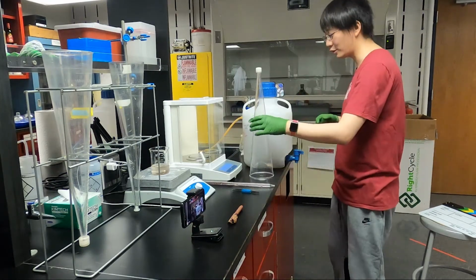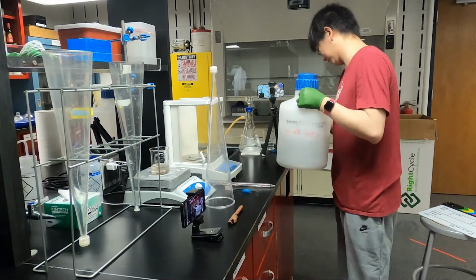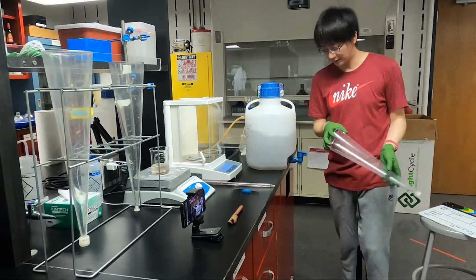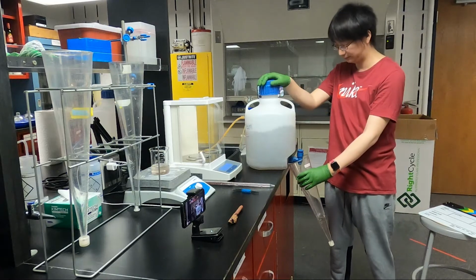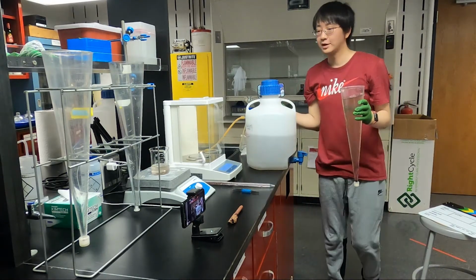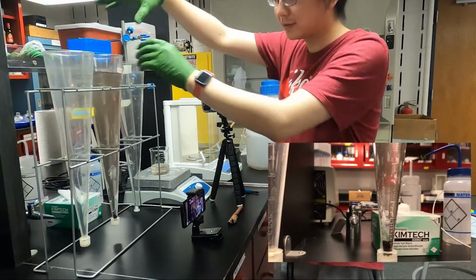And before we take samples, we need to shake it. And then we let it settle down.